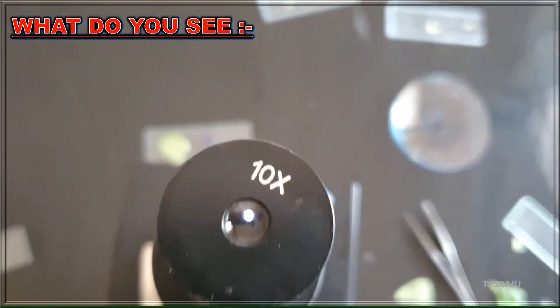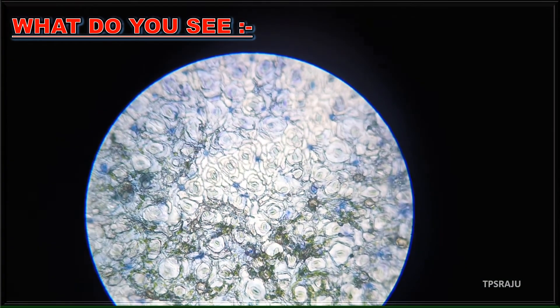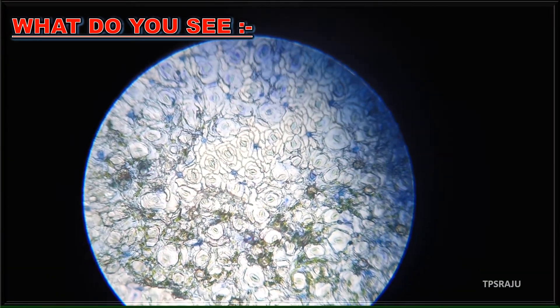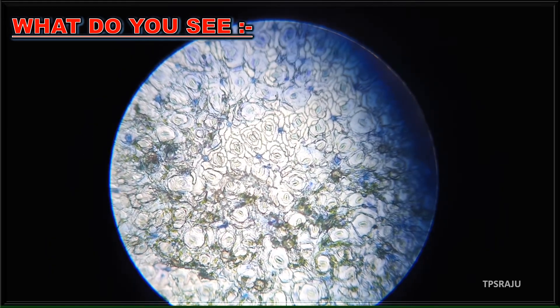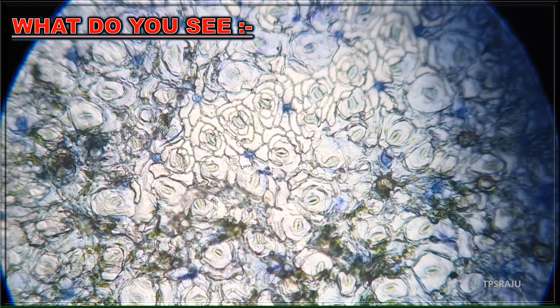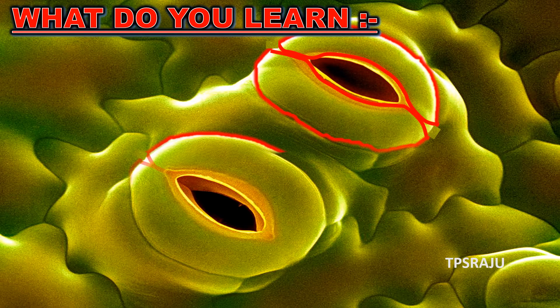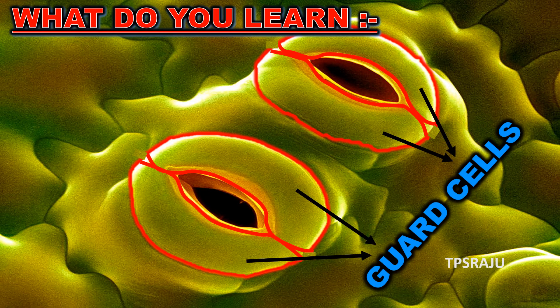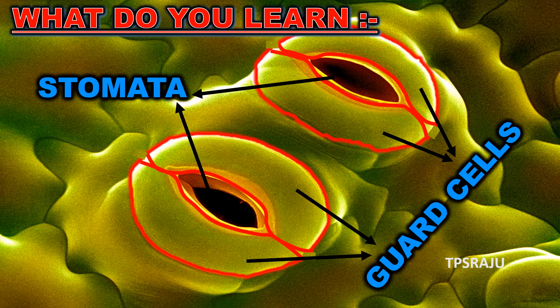Students, observe carefully. What do we see? These are the stomata. The bean-shaped parts that you see in the leaf are called guard cells. The aperture in between the guard cells is called stomata. They act like our nose — they are useful in the exchange of gases between the plant and the atmosphere.